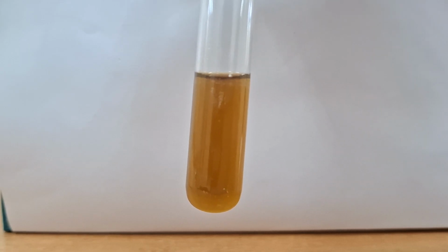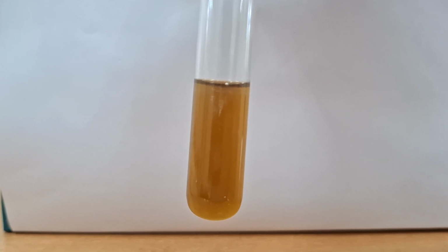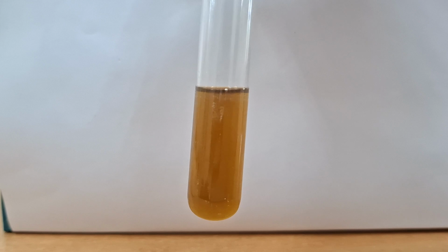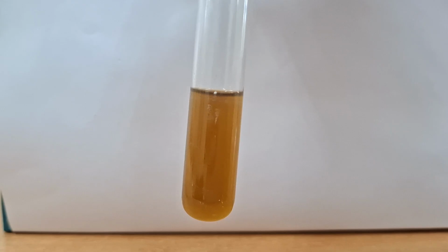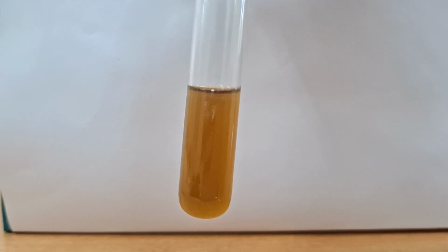I know all of you have the question: the sulfur containing amino acids are methionine and cysteine, but methionine won't give this test, and why, we will see in the subsequent part. So you have to take 2 ml protein solution plus 2 ml of 40% NaOH. Mix the content well and boil it for 2 to 3 minutes. Let it cool down, and then add 2 to 3 drops of lead acetate solution, and again mix it.